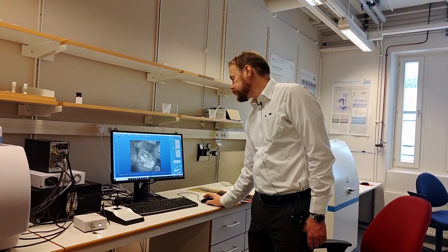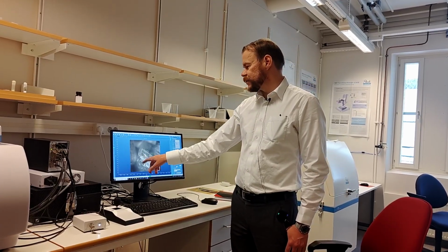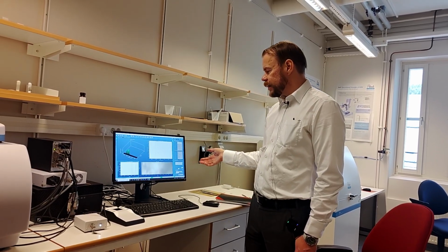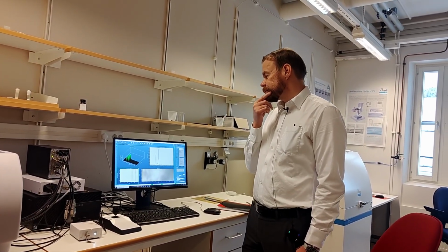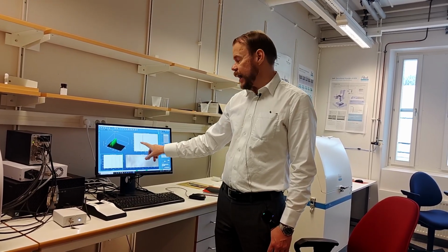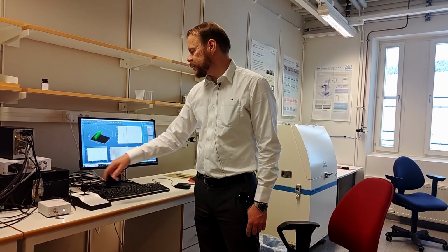So let's do that. And it uses the first point there. So now we're scanning as a function of depth instead. Intensity as a function of depth. And now it says blue map now, you see. So now we get that peak, the area of that peak that we chose before, as a function of depth.